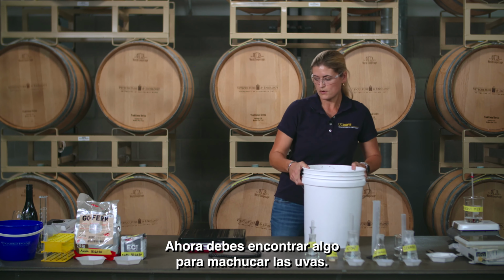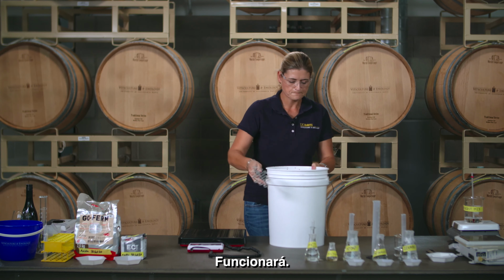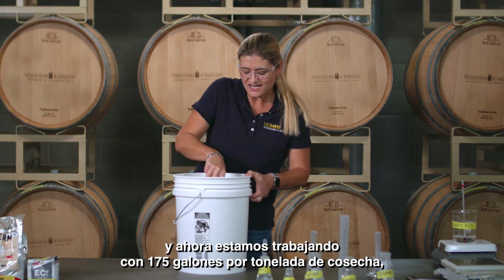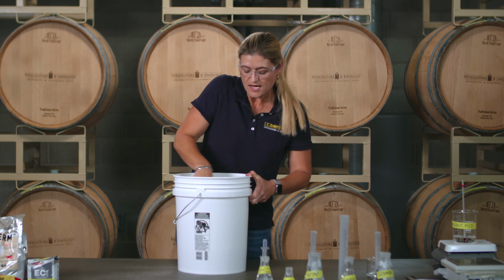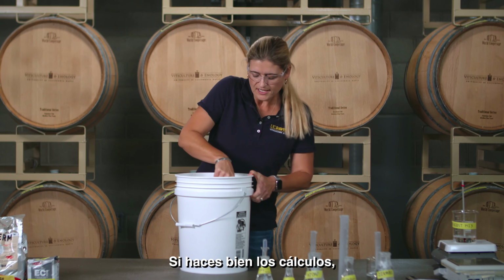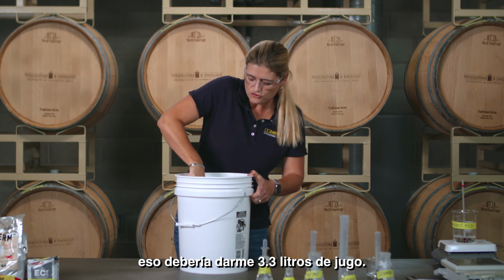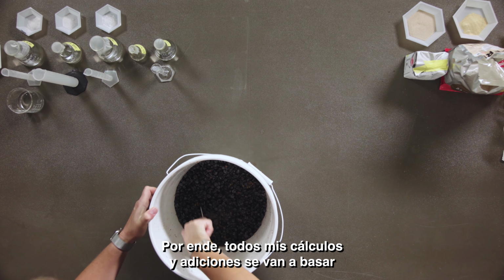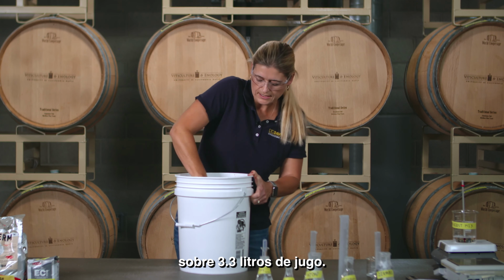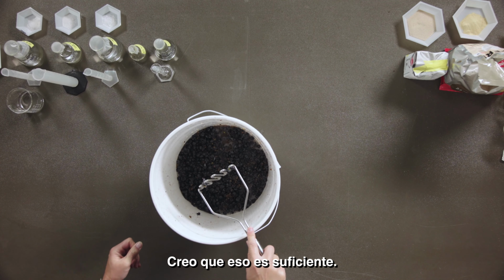Now you want something to crush your grapes. I'm going to use something as simple as a potato masher. It will work. You want to crush your grapes well enough. We're working on about 175 gallons per ton yield. That's about 330 milliliters per pound. If you do your calculations correctly, and I'm working with 10 pounds, that should give me about 3.3 liters of juice. So all my calculations and my additions are going to be based on 3.3 liters of juice. Okay, I think that's good enough.